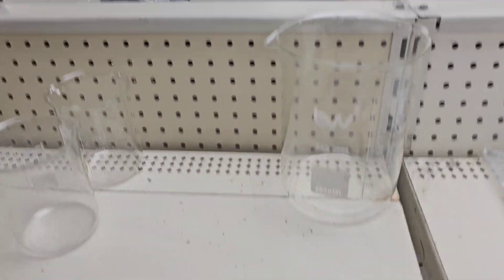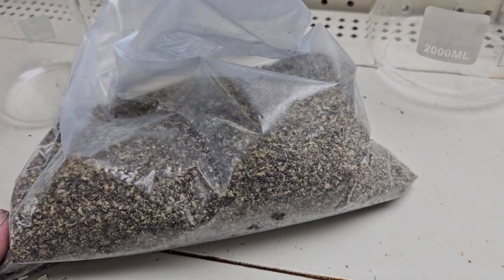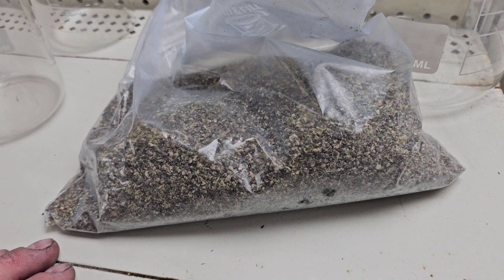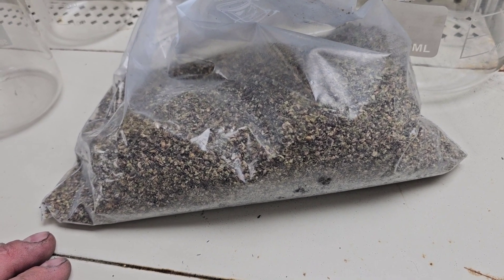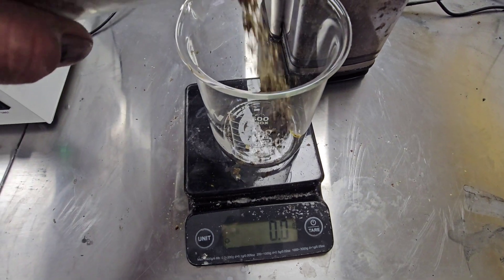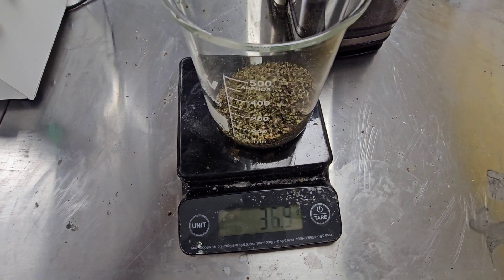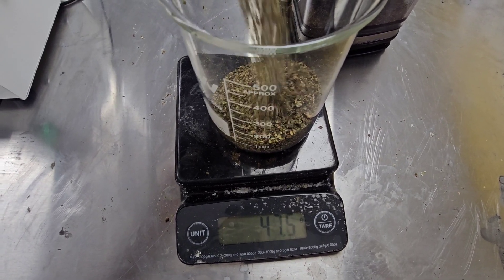Product development experiment day. What are we working with? Boom — this biomass. I'm not going to say exactly what, but we're going to put some grams of it in a beaker, add an enzyme, and see what kind of proteins we can get out of it. We need a 10 percent solids in solution, so we're going to add about 100 grams into about a liter of water.